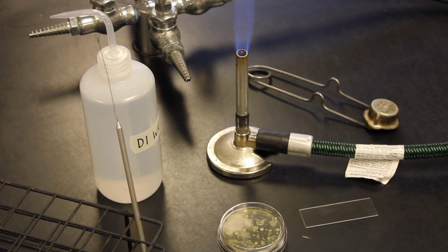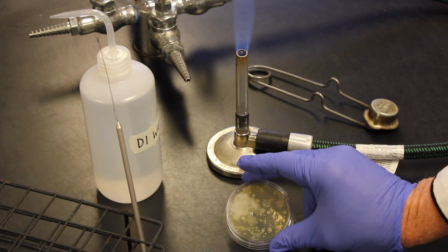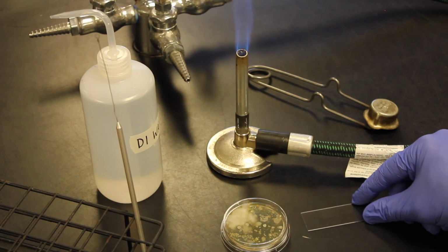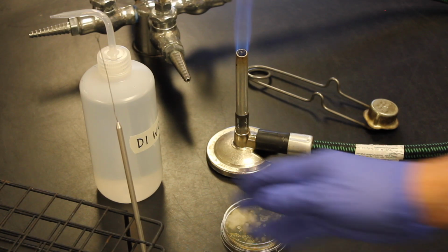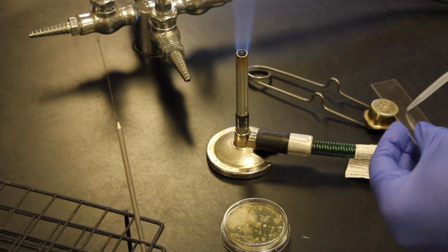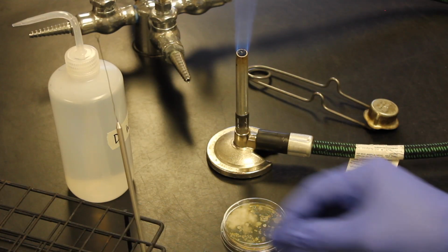Now, I want to show you how to make a smear preparation from a colony on a contact plate. This contact plate was used to press against the computer keyboard, and we can see there's a lot of bacteria, and even up here there's a little bit of a fungus. What we want to do then is choose one of these colonies, move it to a slide, stain it so that we can view it underneath the microscope. The first step then, I want to take some DI water and put a teeny tiny drop of DI water on my microscope slide. Okay, that allows everything to spread around nice and easily.